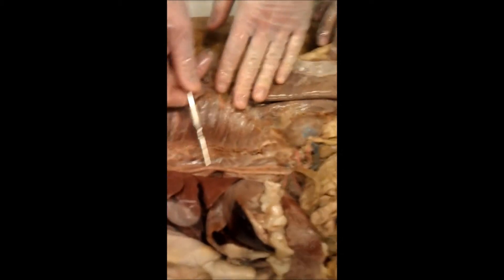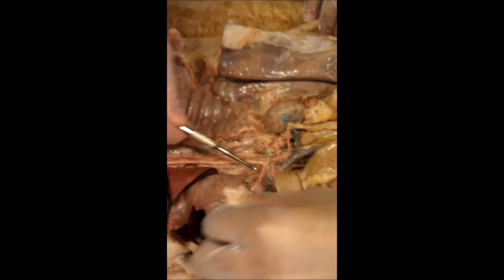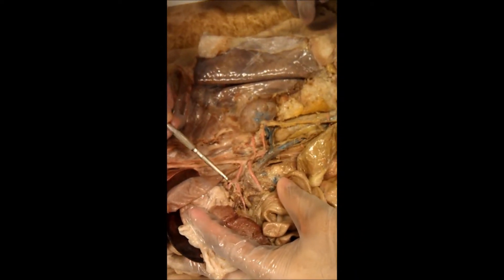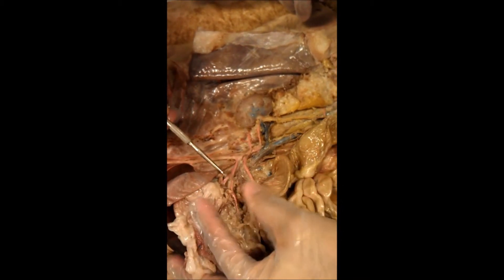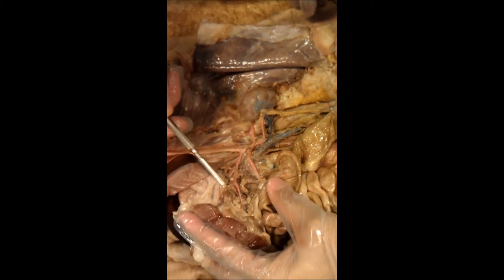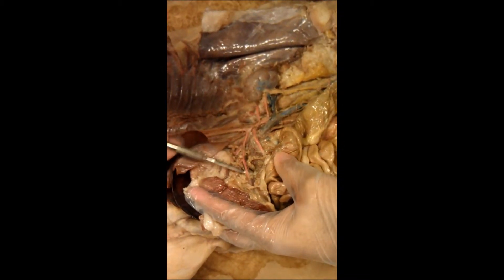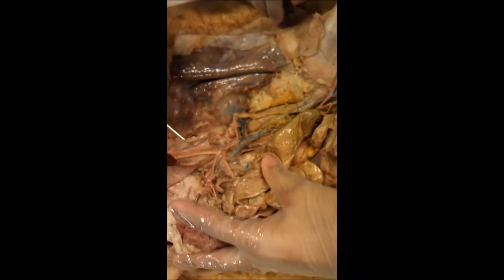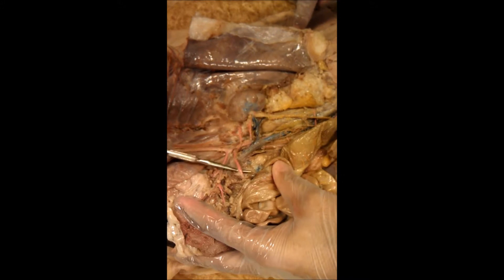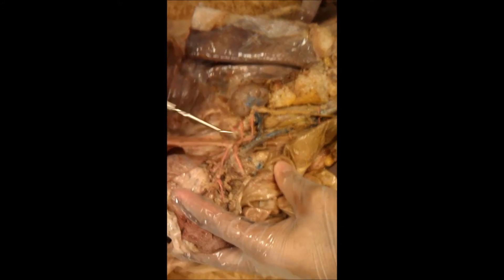Here we have the descending aorta. Here we have the celiac artery. Here is the left gastric artery. Here's the hepatic artery going to the liver. And here's the splenic artery going to the spleen. Moving down, we have the superior mesenteric artery.